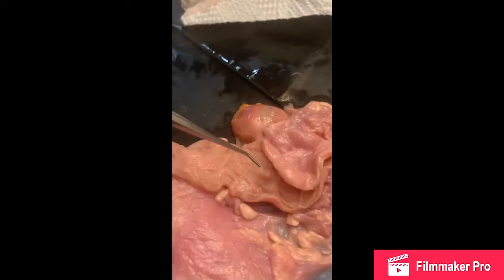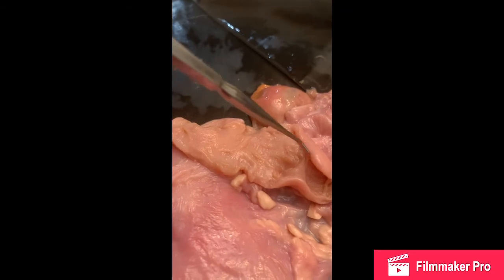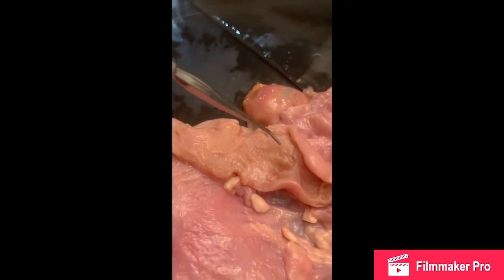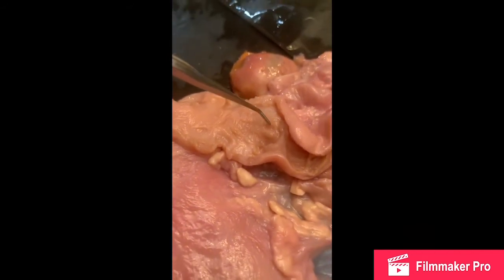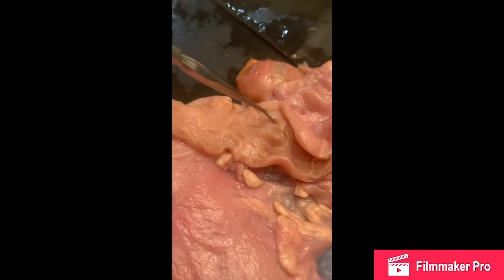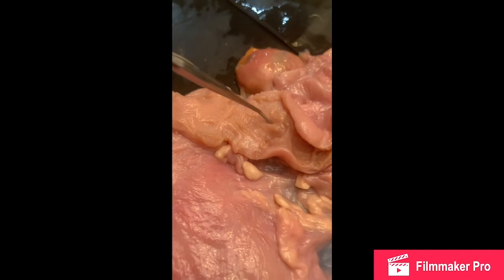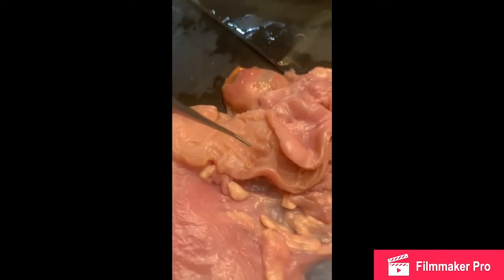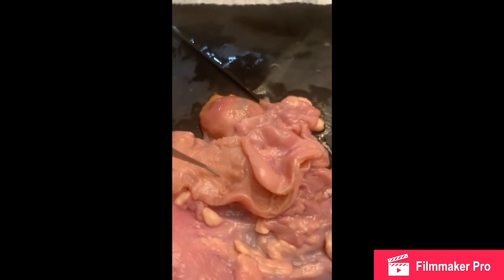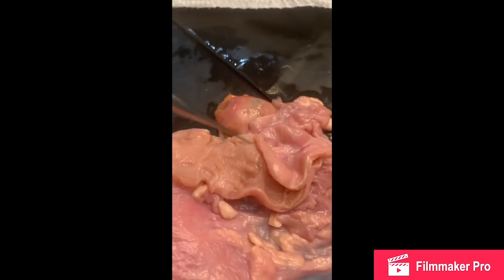Hard to tell in this one, but we can kind of see a small caruncle, which is going to be important for placenta attachment. It's very, very hard to see. There's a very tiny one about here, and I think another one right here. These are important for attachment of the placenta when there is a baby that is going to be inside, and this is where the placentas are going to attach.